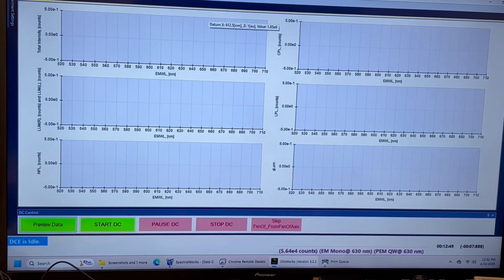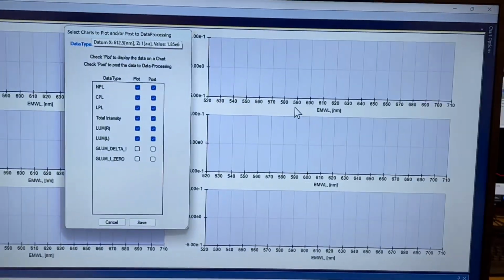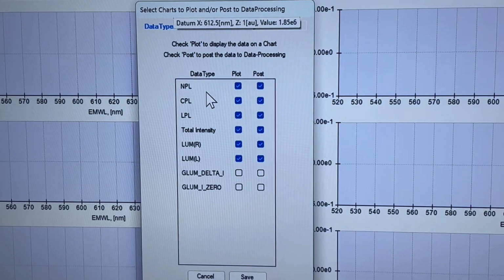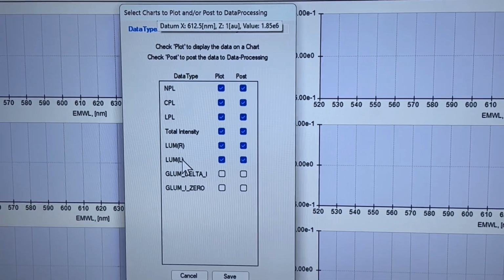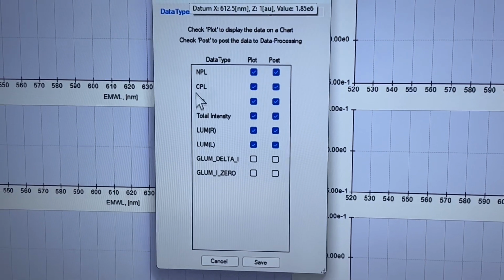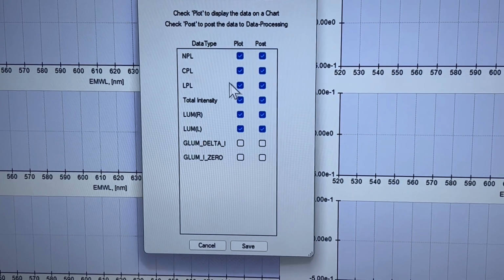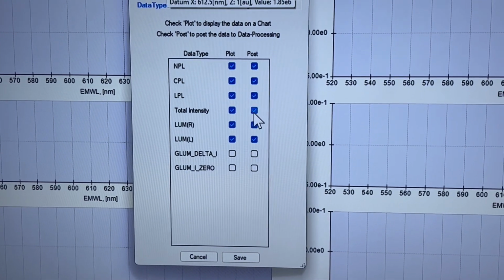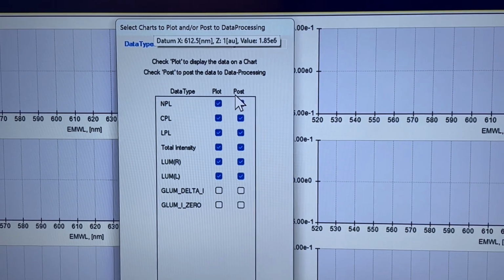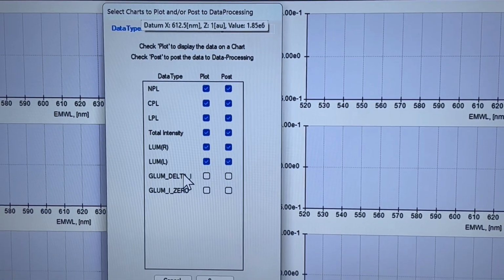Right. But let me emphasize, over here with chart selection, what I've done is to choose to see the left and right luminescence, the total intensity, and the non-polarized, linear polarized, and circular polarized. And this row of numbers is checked saying that I want to post them, i.e. when I ask to store the data, these several go with it.